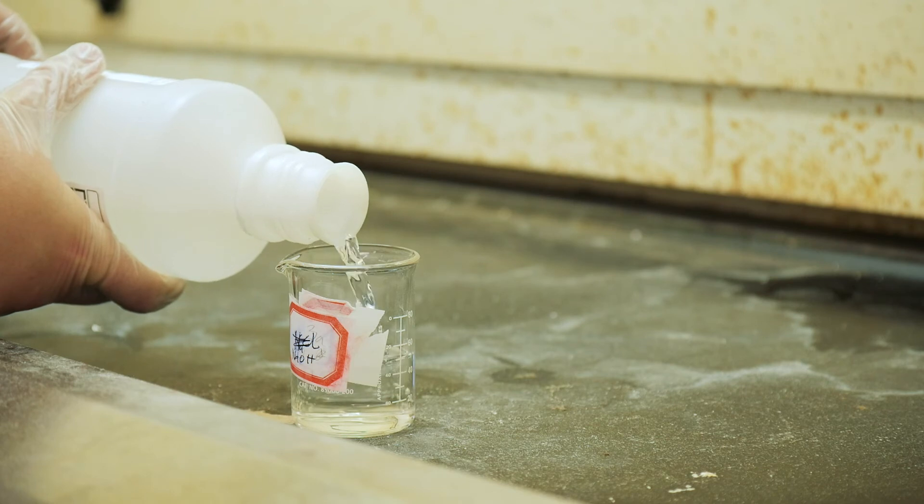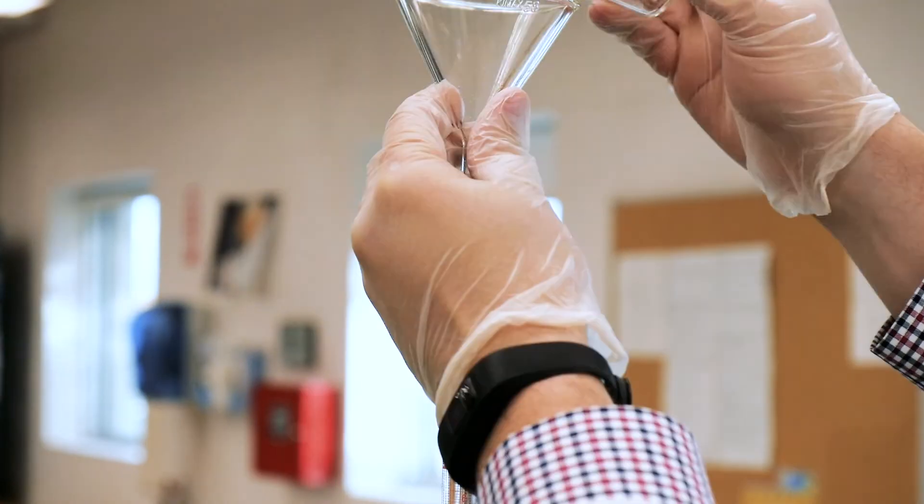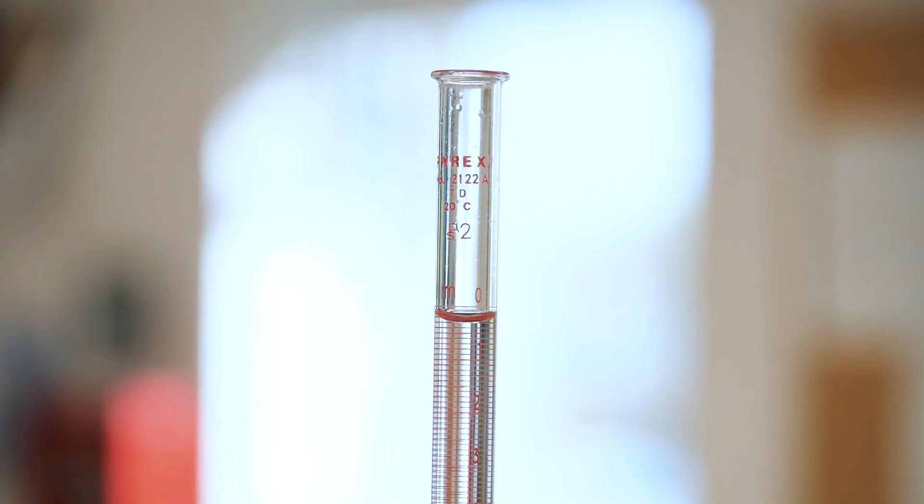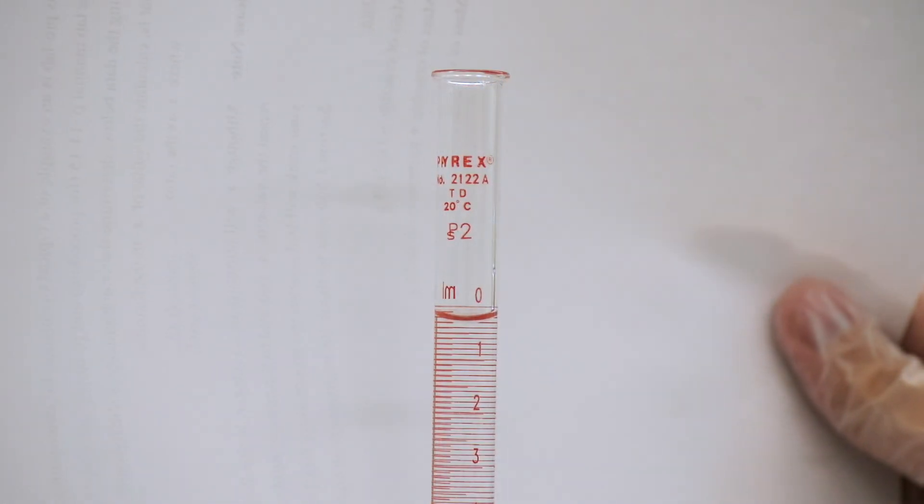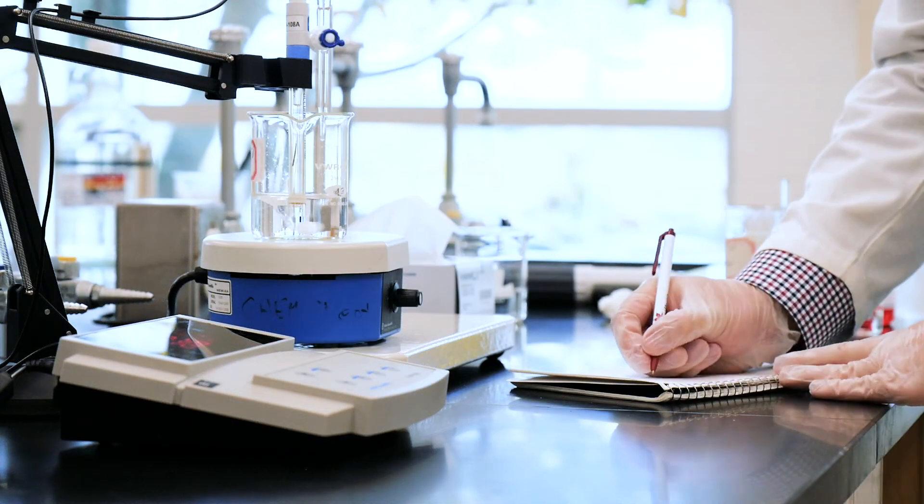At this point, you can fill your burette with standardized NaOH solution and adjust the level to around 0 ml. Get your burette mounted in a good spot so you can make additions directly to your beaker and record the initial pH.